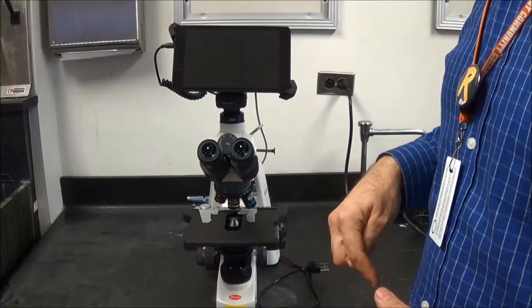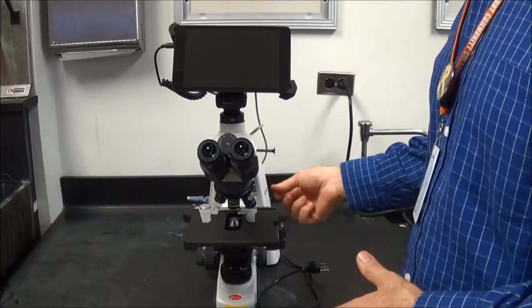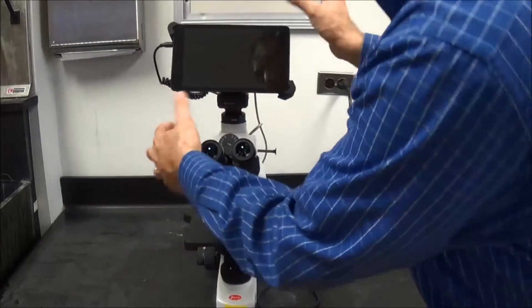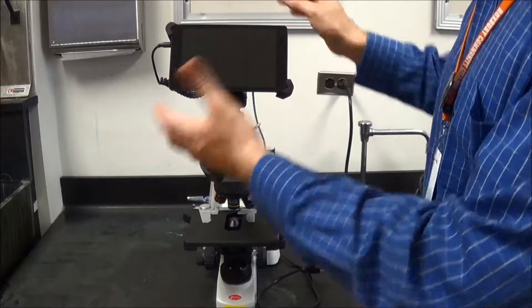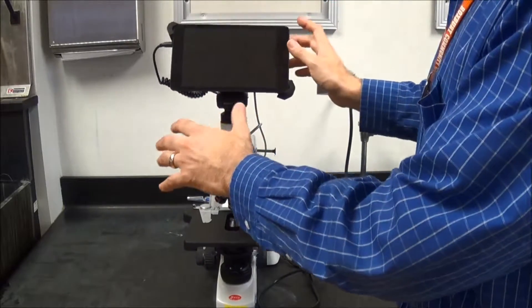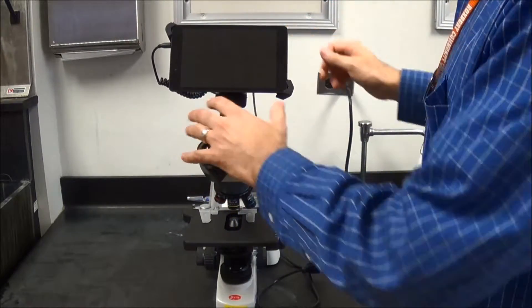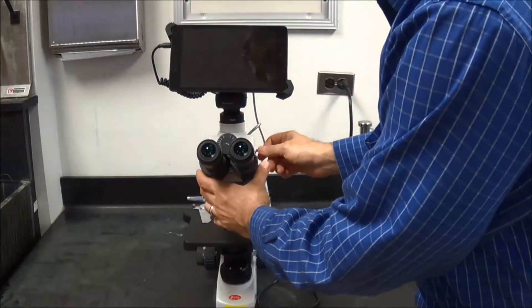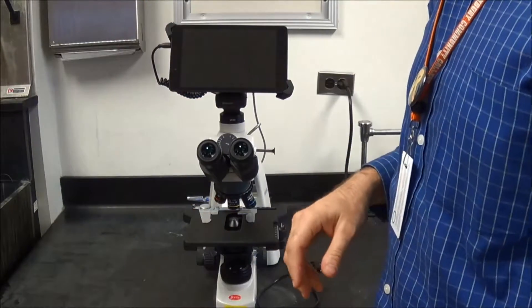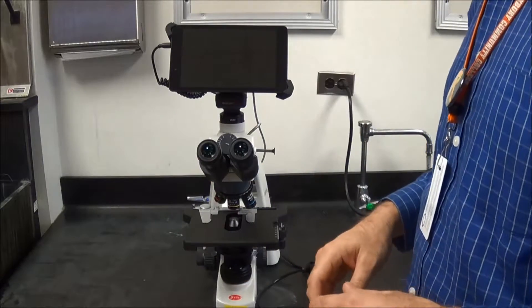What we found is in the past, when students would unscrew the heads, it would loosen it to the point where the head could potentially fall off. As you can see, the microscope on its own right is not going to fall over unless I push it really hard. But if this is loosened, that would just topple it right over, and we don't want that to happen.